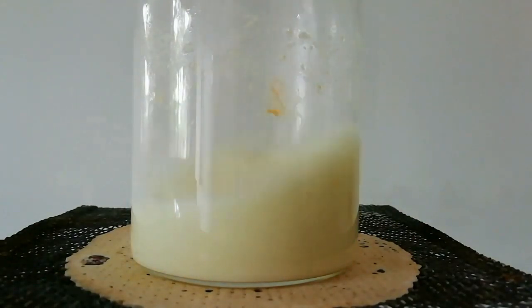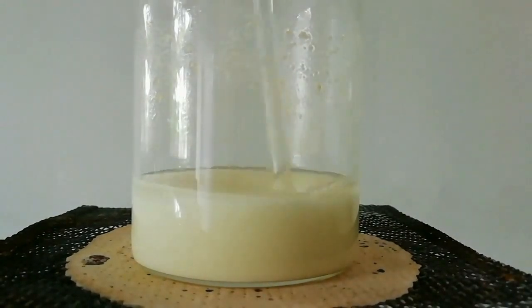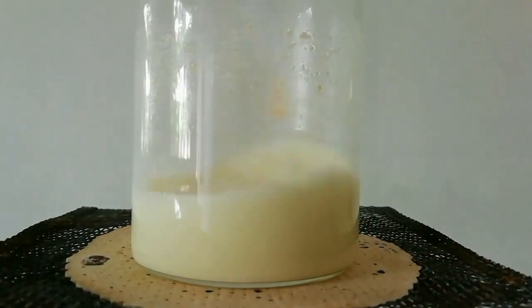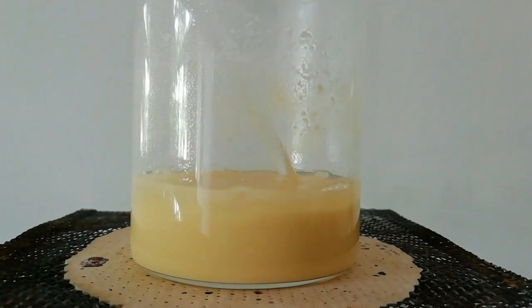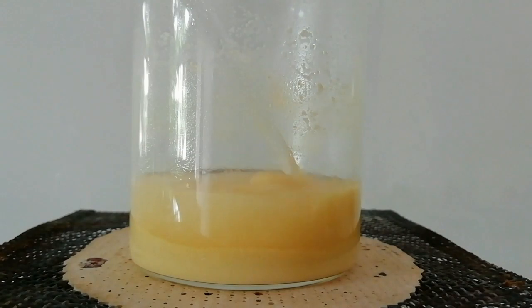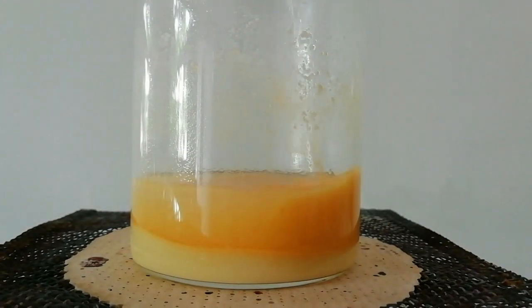Addition of sodium hydroxide may cause the solution to boil. Here, bismuth nitrate is converted to bismuth hydroxide and quickly bismuth hydroxide turns into bismuth oxide.